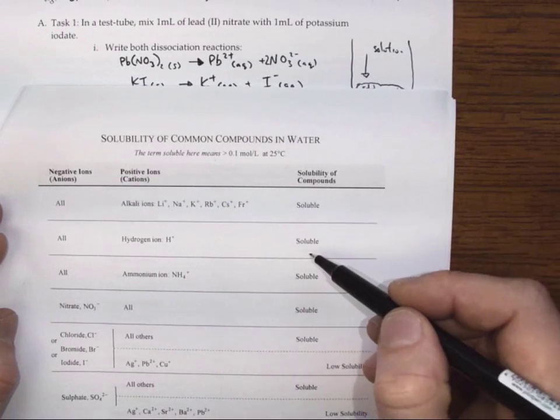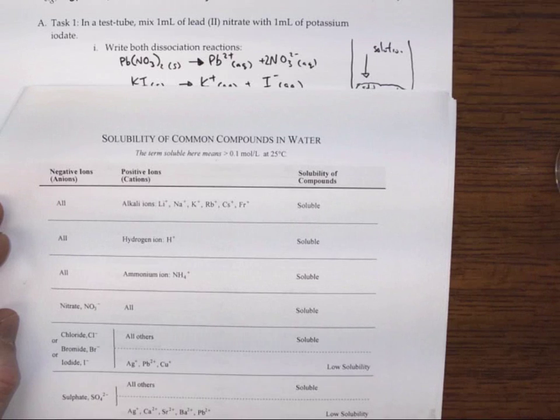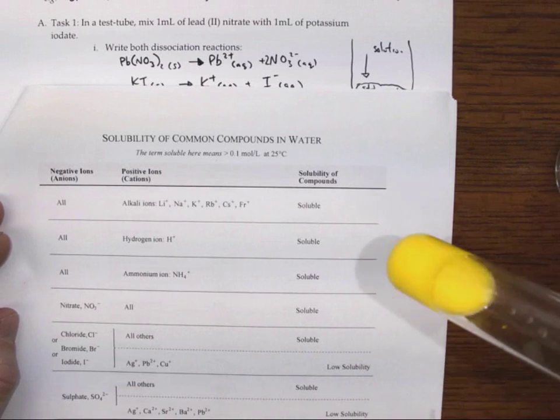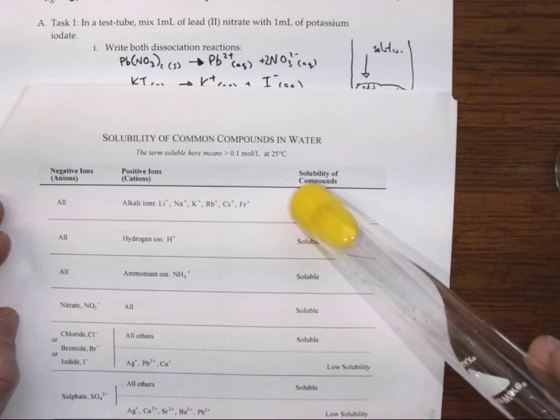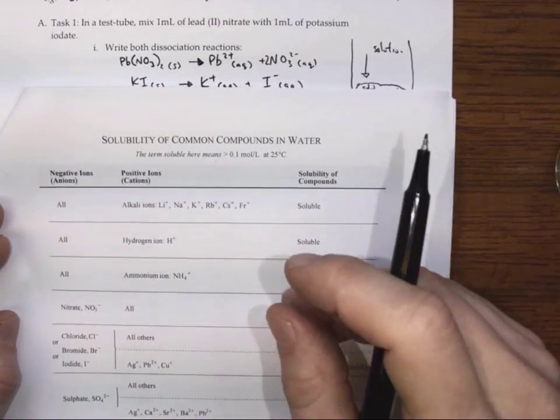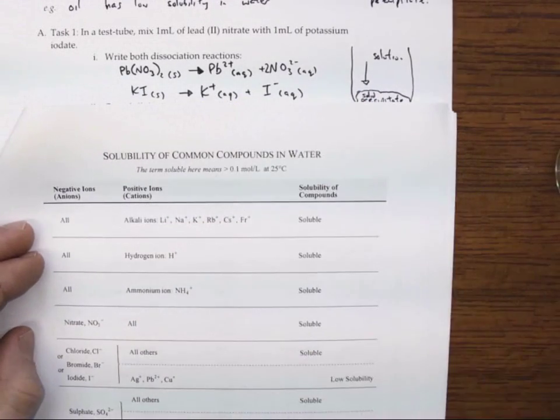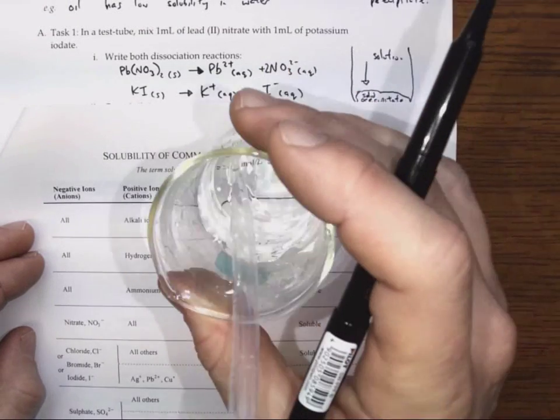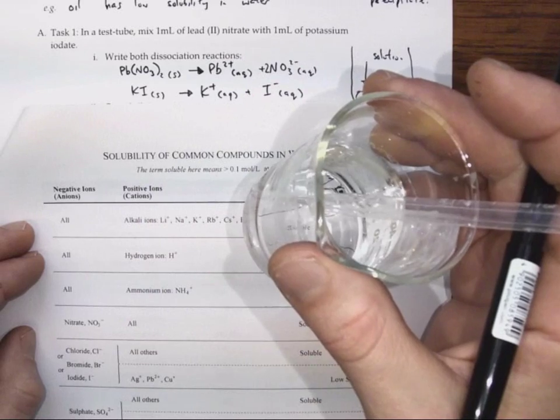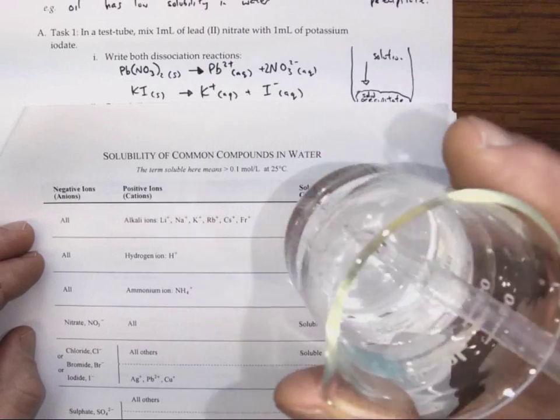either give us very soluble compounds that exist in solution, like, say, potassium and iodide, or if they mix together to make something insoluble, like this substance that is going to precipitate and settle out of this solution. Alright, so let's start with the combination of iodide and potassium. So we already know, or we get the observation, that this should form a solution. These should be soluble in water, because we don't see any potassium iodide floating at the bottom.